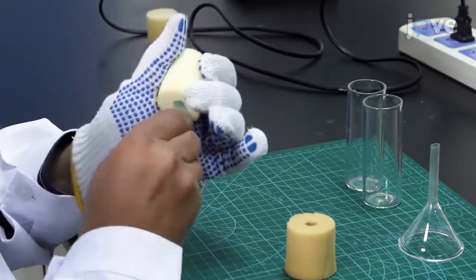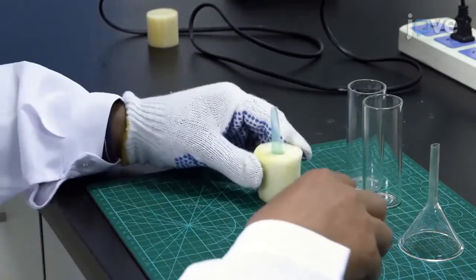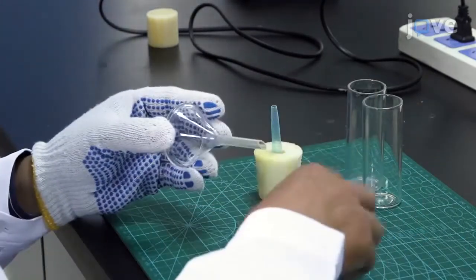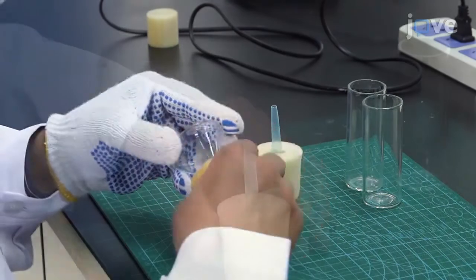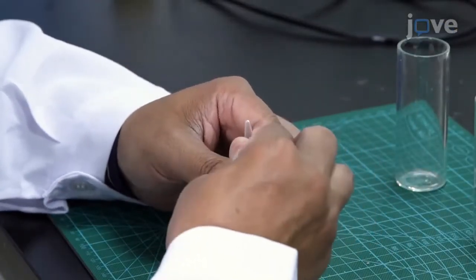Insert the elongated micropipet tip into one sponge plug and insert a funnel into the other sponge plug. Cap the pipet tips with individual 100 µL microcentrifuge tubes.